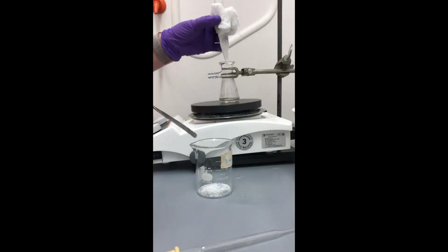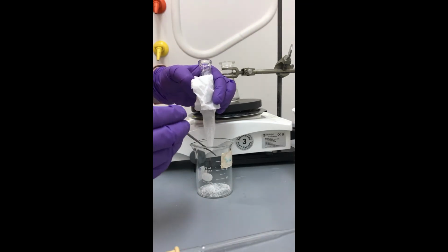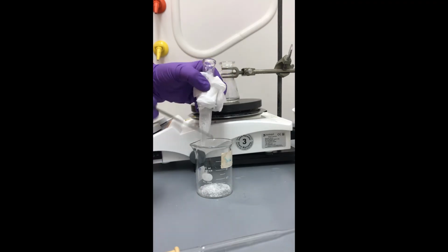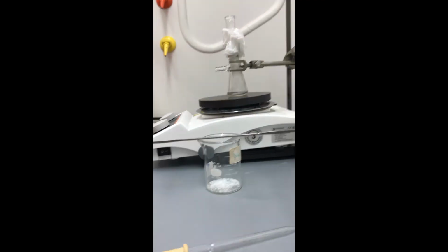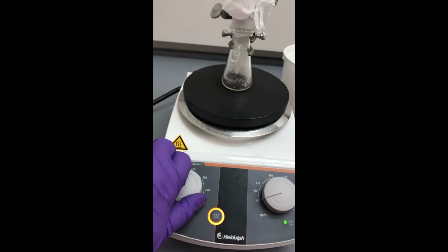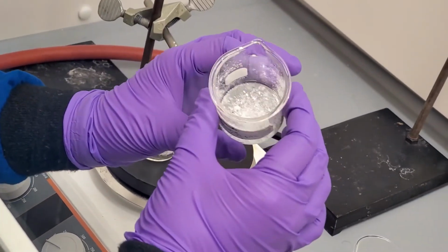The cold finger is once again covered with pure naphthalene crystals. We will scrape them off for the final time. In a moment, we will see that there are no more naphthalene crystals on the bottom of the flask, but the sides are covered with possible impurities or deposited naphthalene. Now we can turn the temperature of the hot plate down, turn off the heat, and turn off the hot plate. Look at those beautiful naphthalene crystals.